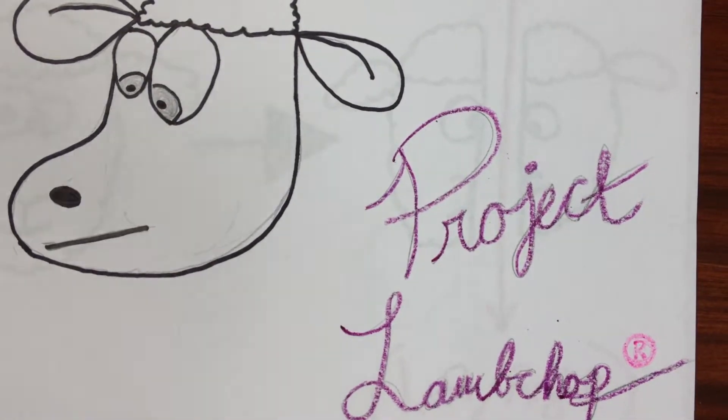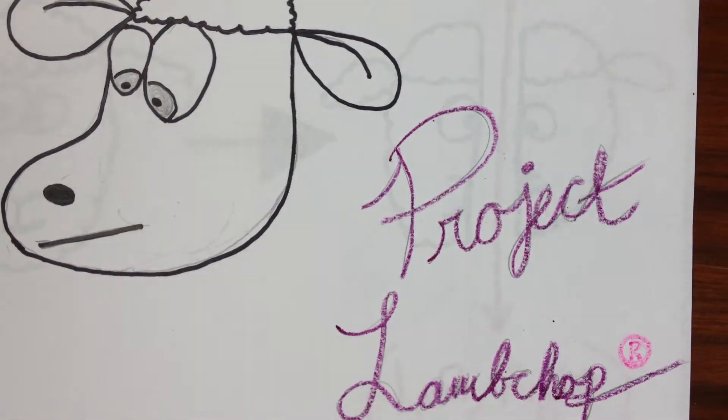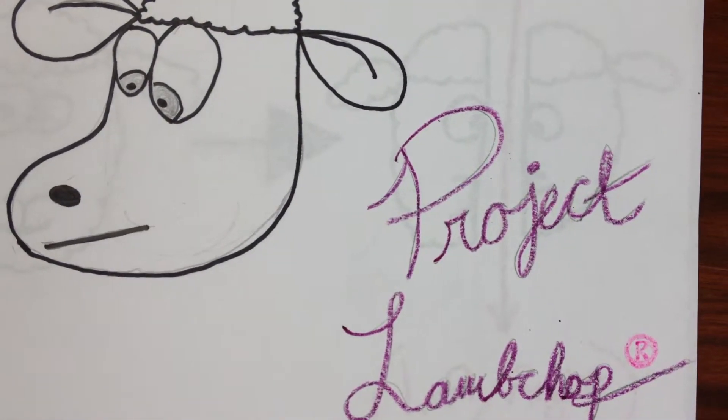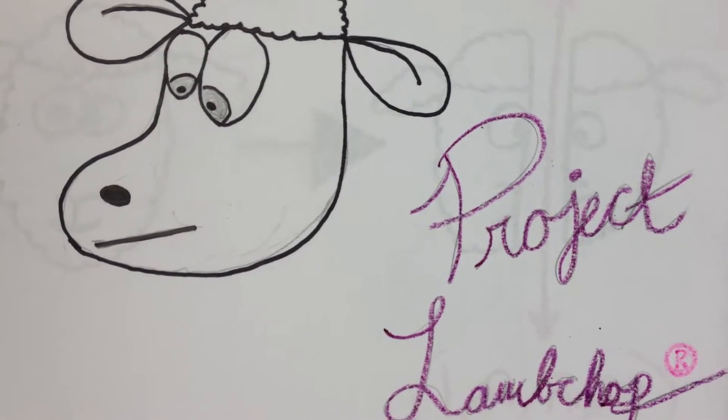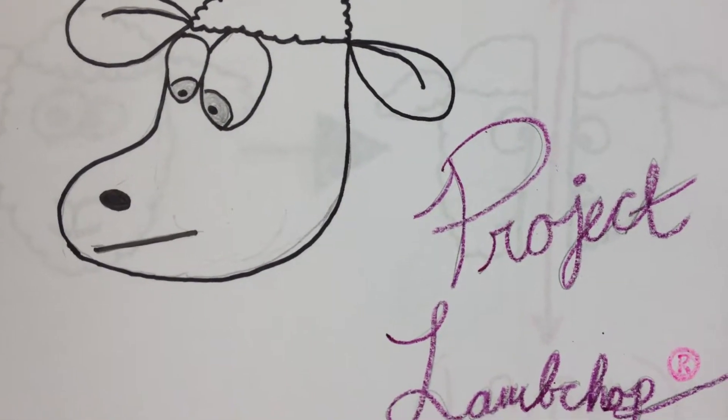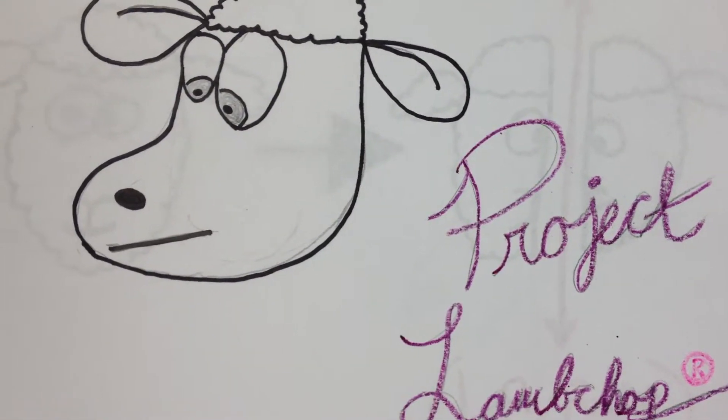Hey, this is Project Lamb Chop, and we're going to be doing a sheep brain dissection demo for you so you don't fail your lab practical.